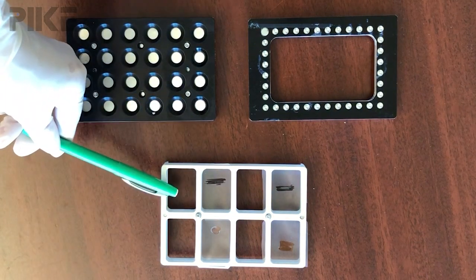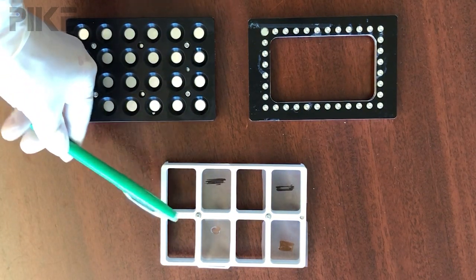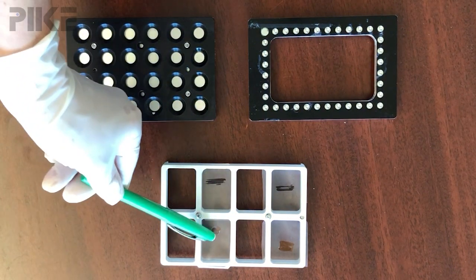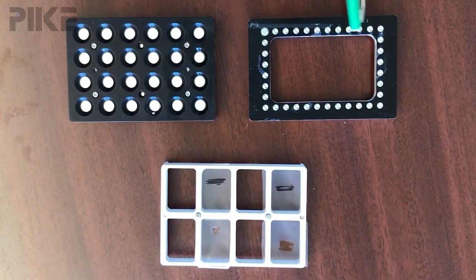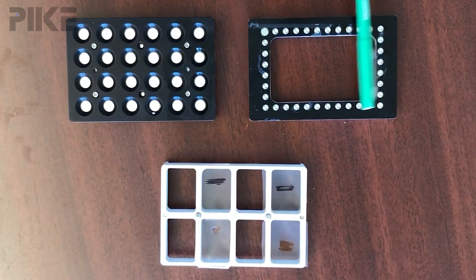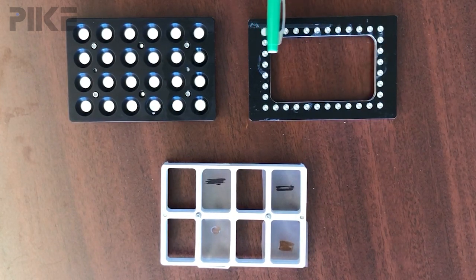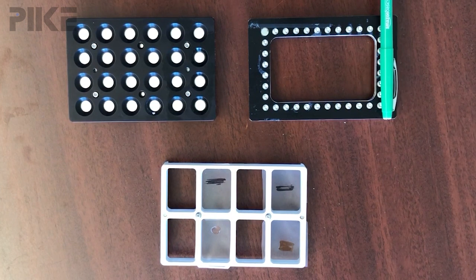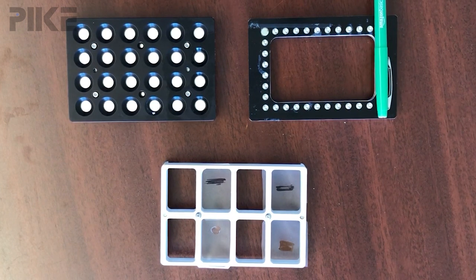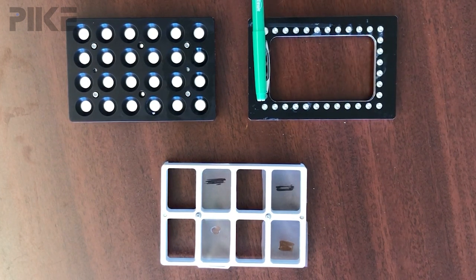The first is an eight-position transmission plate to hold films. This is a plate that our machine shop whipped together for me when I asked them for a plate that would allow me to mount a film across an opening.